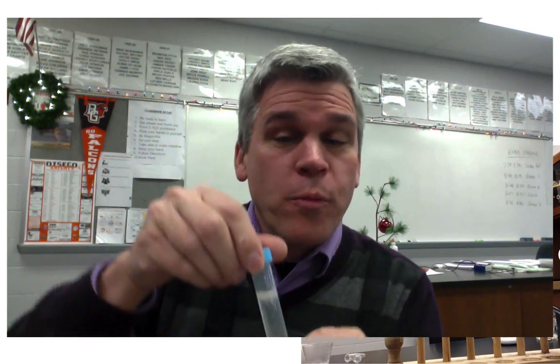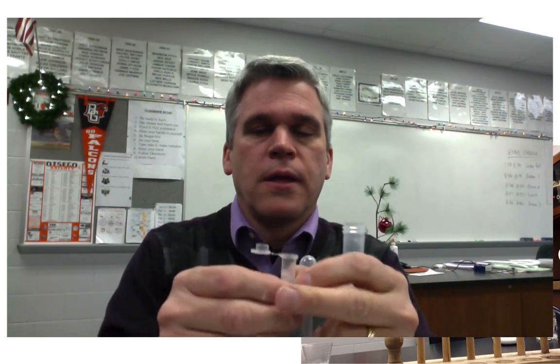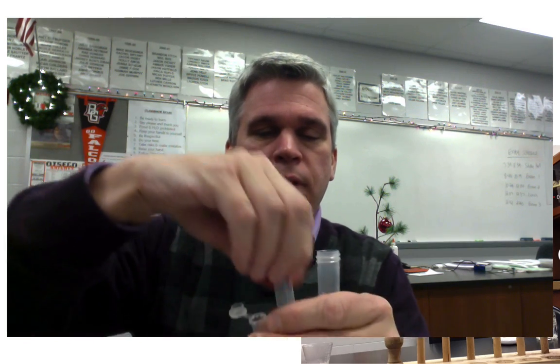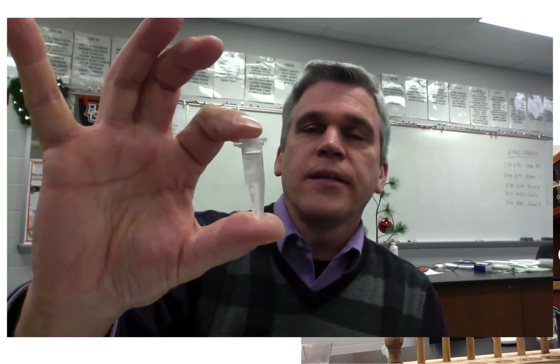After 15 minutes, you're going to find a big area of white stuff — those are your chromosomes. Use the dropper and get up as much of that as you can, and simply put it into a small test tube. And now you have a test tube of you. Simple.